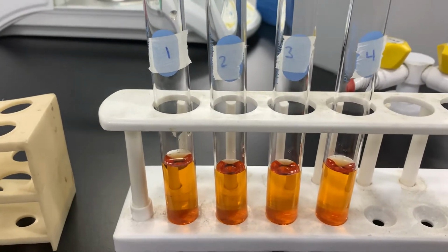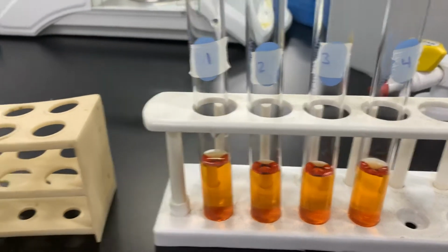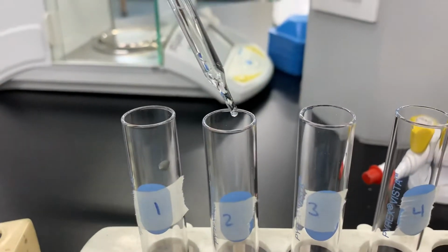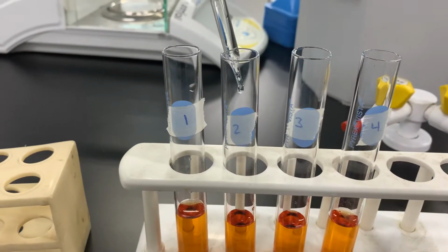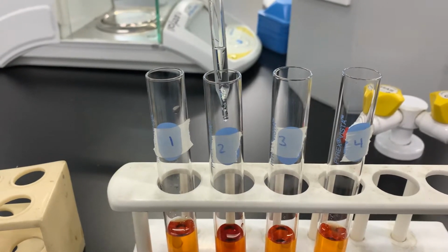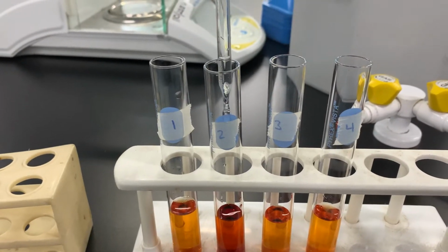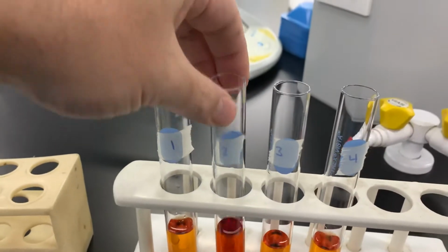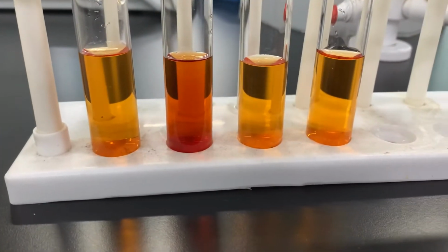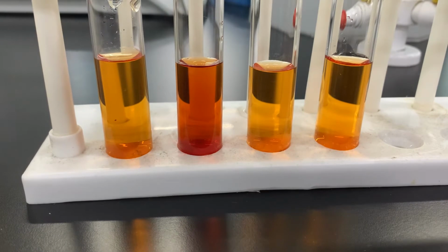To test tube number 2, I'm going to add approximately 10 drops of iron ions. Here I am getting the iron ions out of here, and I'm going to add them into test tube number 2. We'll see what happens. There's 1, 2, 3, 4, 5, 6, 7, 8, 9, and 10. We can now take a look and see the difference between the two. If I added the 10 drops of iron plus 3 ions, the colors changed somewhat.